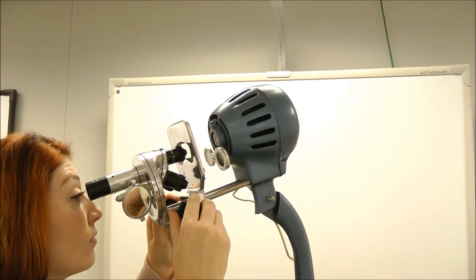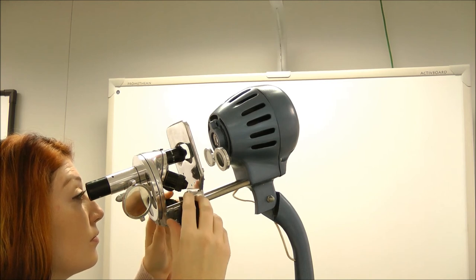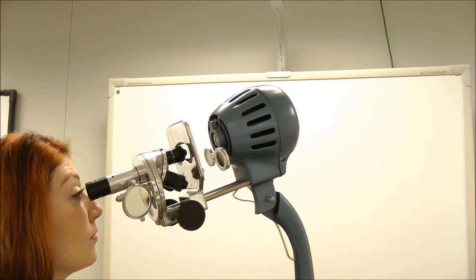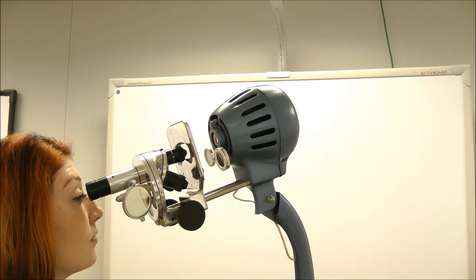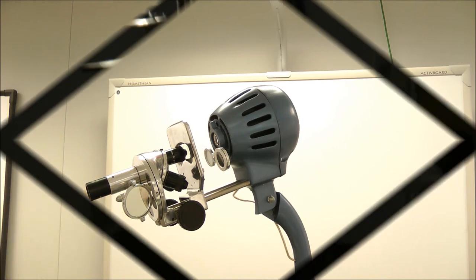If the user wishes to use the microprojector as a traditional microscope and no projection, just remember that you will need to have the head in the horizontal position. And then the viewer may view through the eyepiece on the bottom of the head.